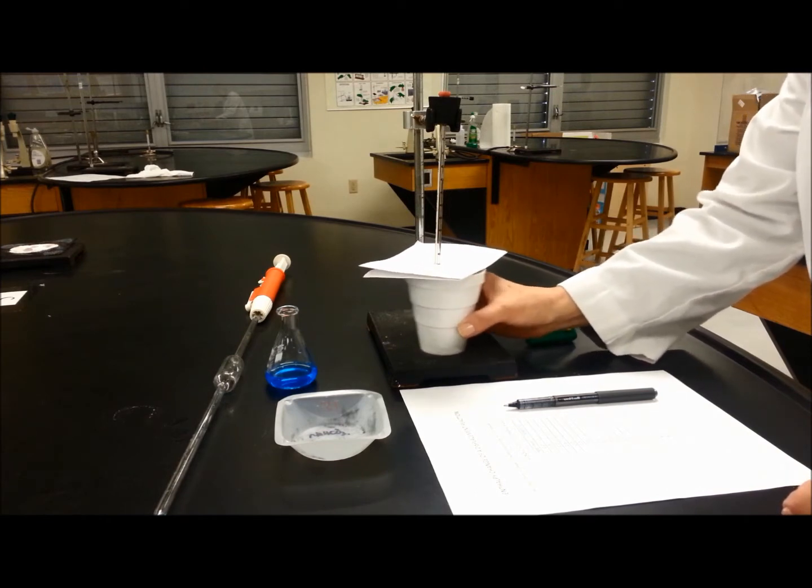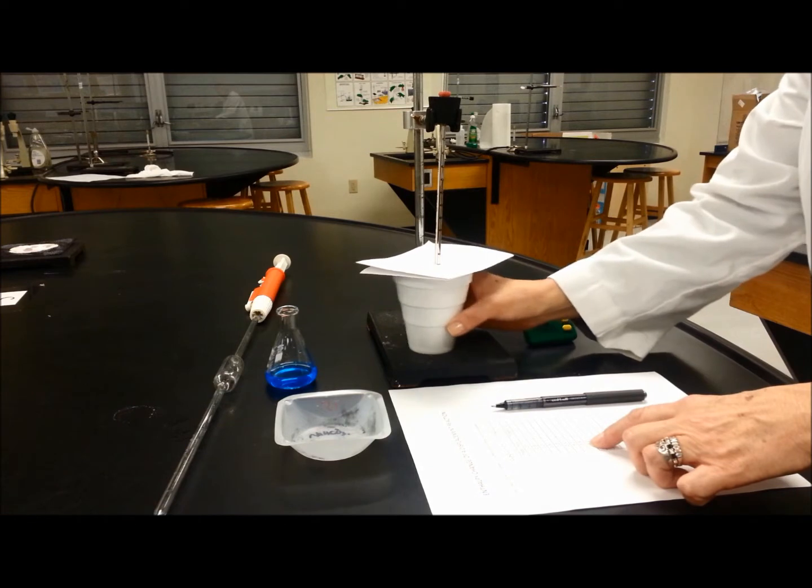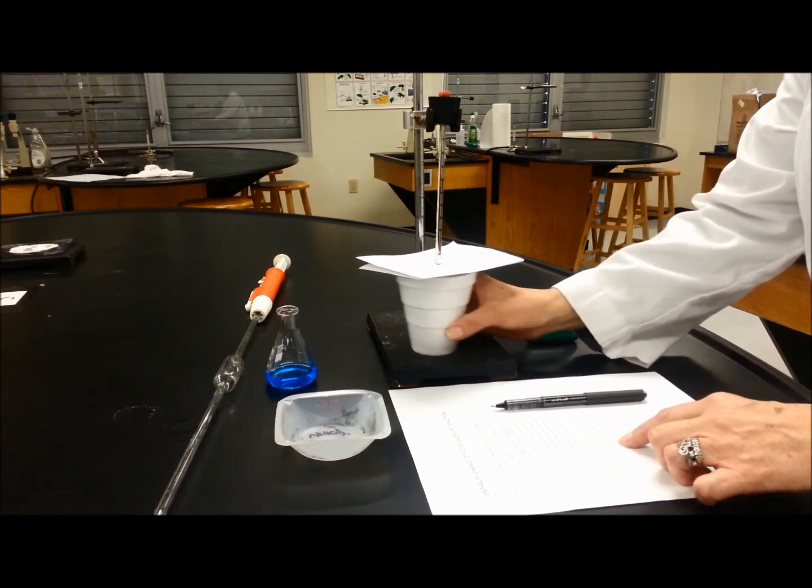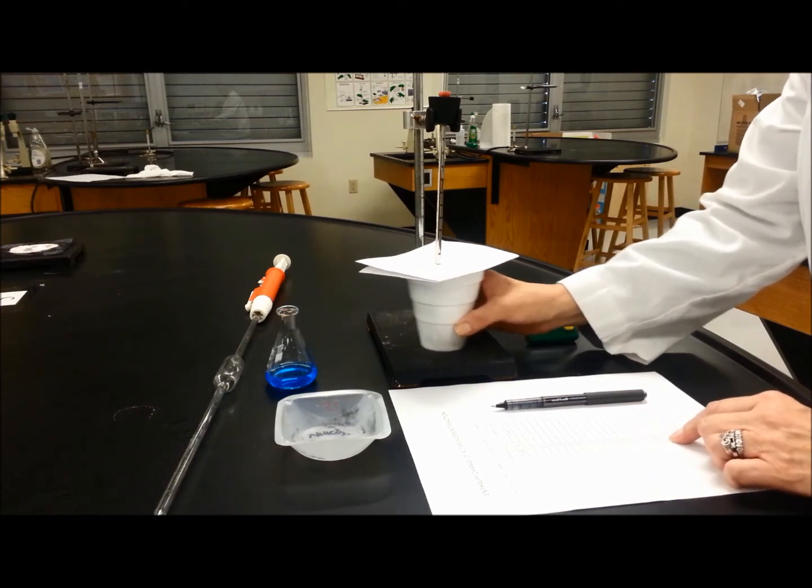And begin measuring, continue measuring every 30 seconds until you get to nine minutes.